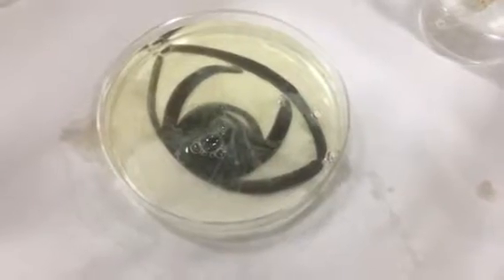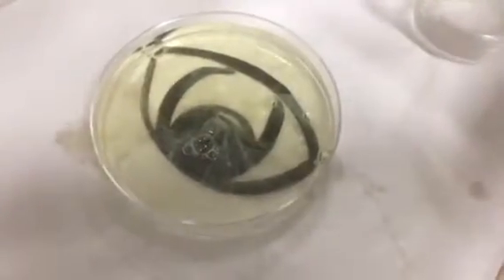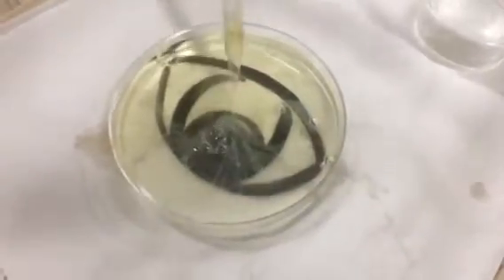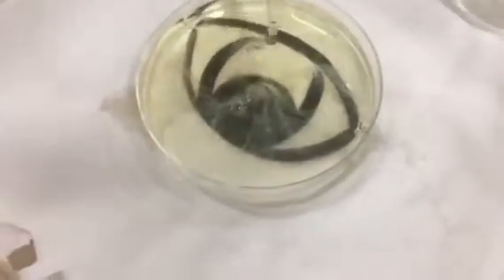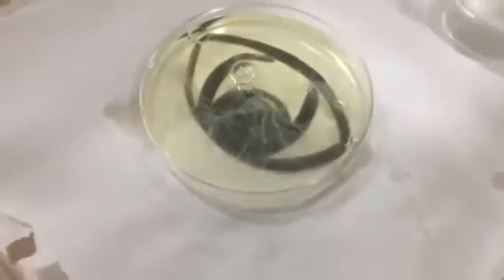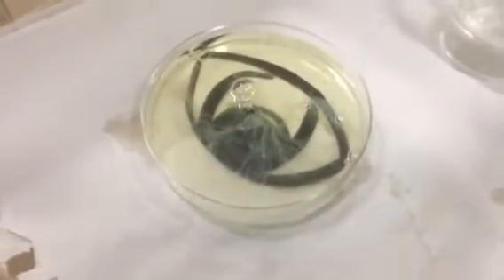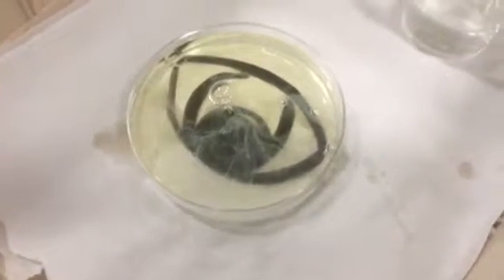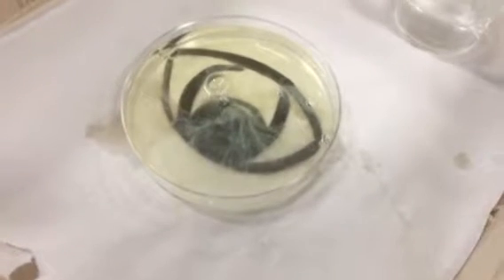So there's a little bit of a bubble. It is not smoking, but what's happening to the egg? What color is it? It's like cloudy. It's getting cloudy. What happens to an egg when it turns cloudy, when it turns white? It's cooking. So what does the sulfuric acid do to your eye? It cooks it. It burns it.